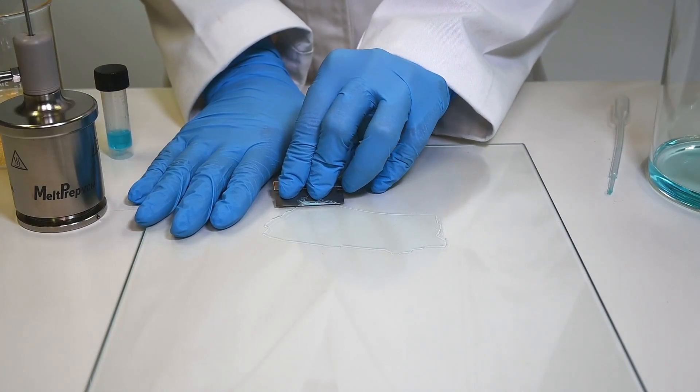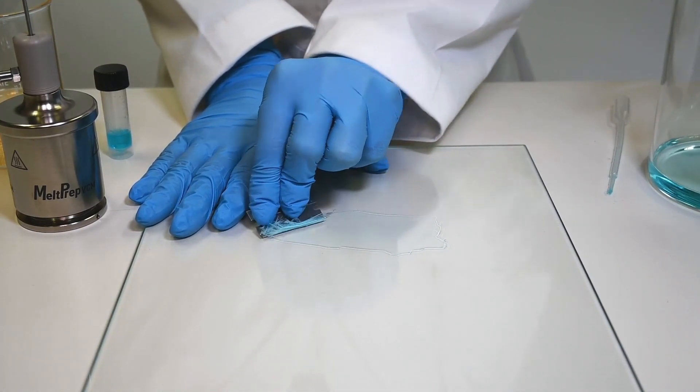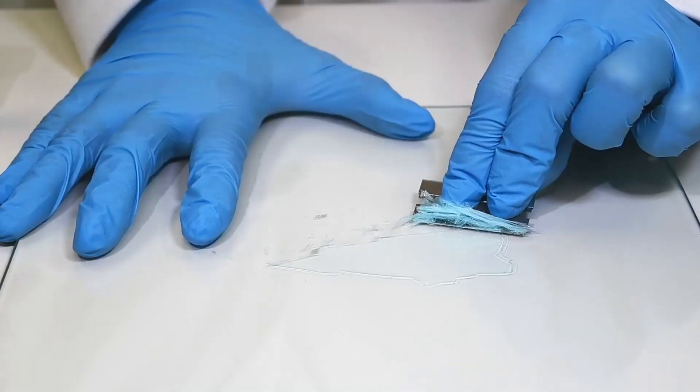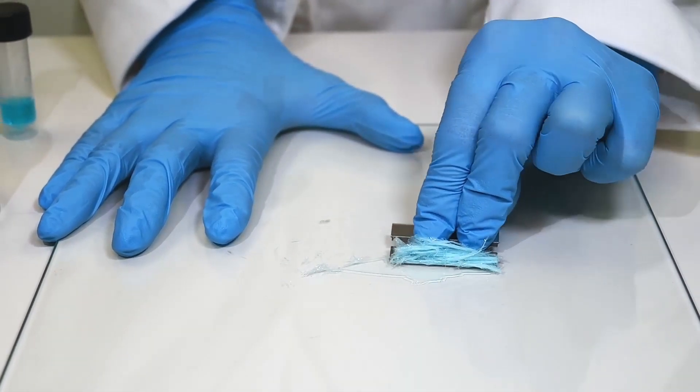Remove the residual with a razor blade. If the residuals break into tiny splinters, try warming the plate up slightly in an oven. Do not worry if the film turns opaque. In many cases, this is only temporary.